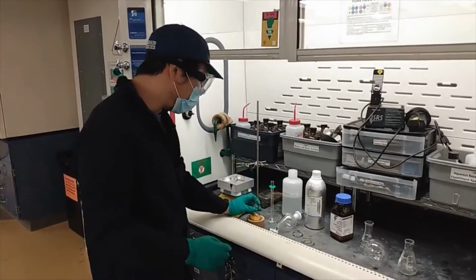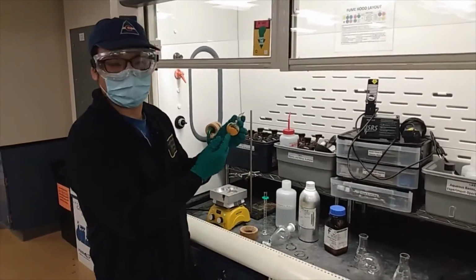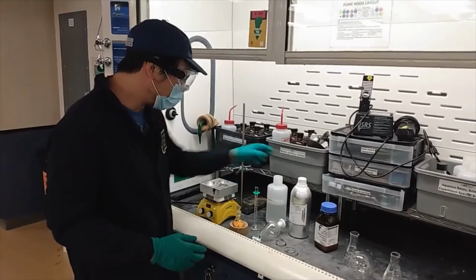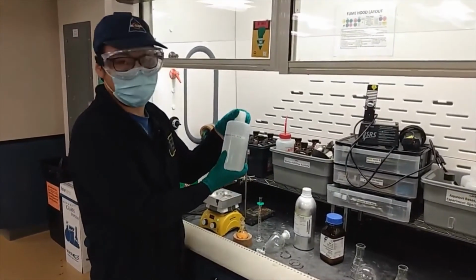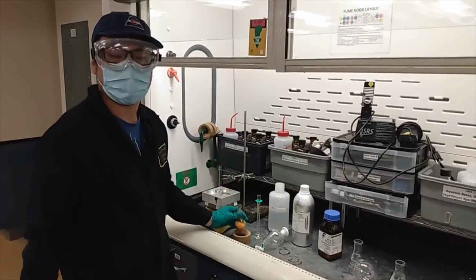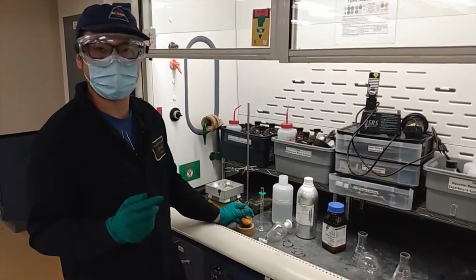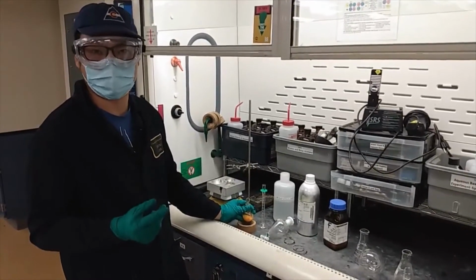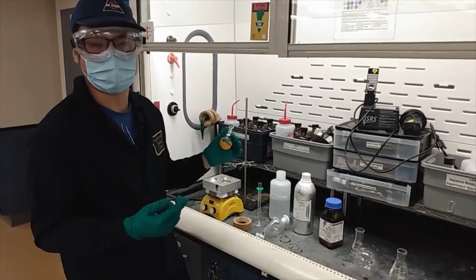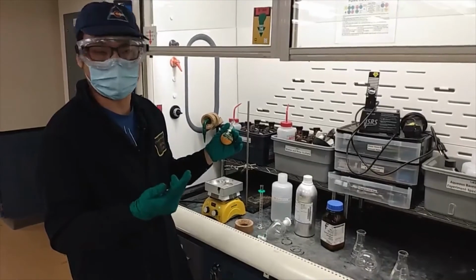And the first thing we will have to do is neutralize the unreacted or the remaining sodium hydroxide here. What we're going to do, we will use 3 molar hydrochloric acid to neutralize it. And besides neutralizing the sodium hydroxide, the one more thing is because we have the OH on the benzene ring, that one is also acidic. So if we don't neutralize it, that will also react with the sodium hydroxide. So that will likely bring our product into the aqueous phase.